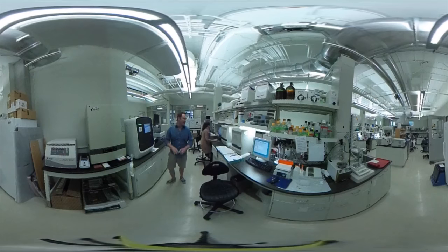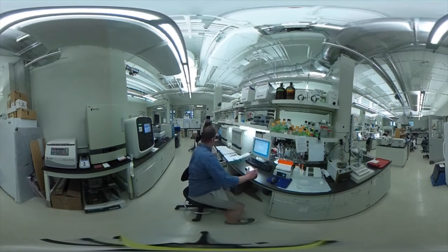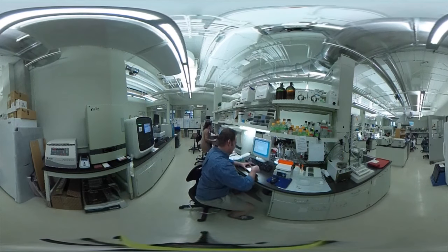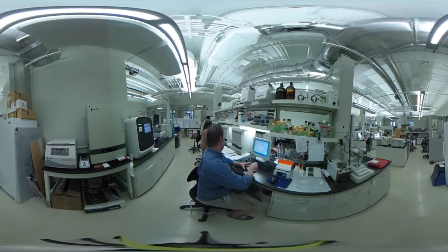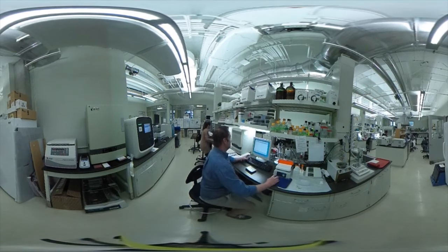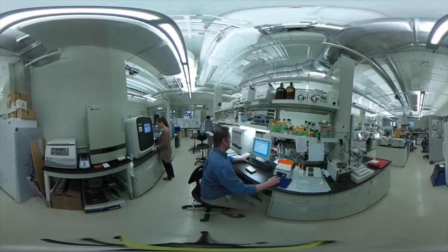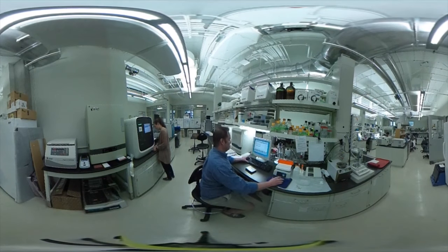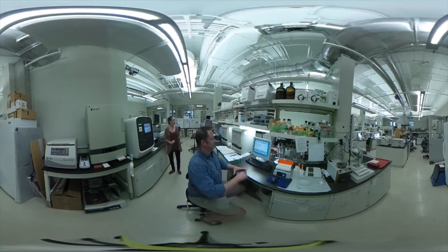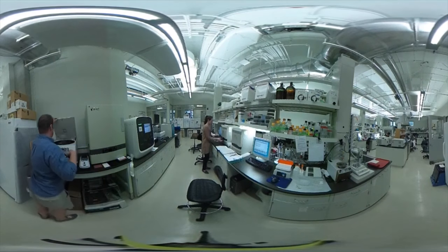We have general PCR — polymerase chain reaction — where we amplify a specific region of DNA and ask: is it there or not? When we move to quantitative PCR, it allows us to ask: is there more or less? For example, if we're looking at a certain fungus on a tree, we can ask: is there a lot of that fungus, a little bit, what kind is it, and is there a close relative associated with it?